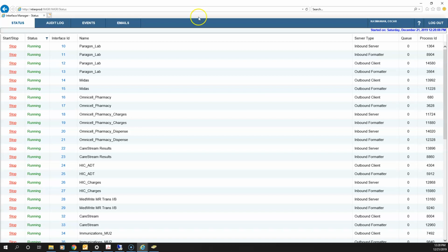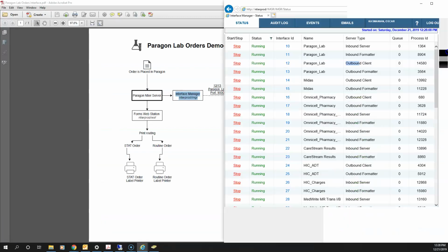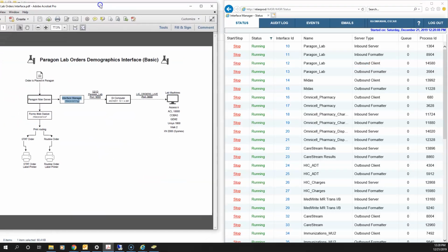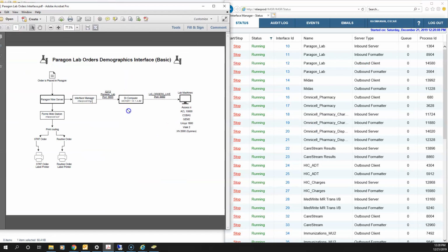Okay, so this is the first step in the orders interface. The order is leaving Paragon, right? So what do we understand by that? That means that it is an outbound interface. It is going out of Paragon. It is an outbound interface. I've listed that here. See if we can do the side by side. Okay. So I've listed that here.